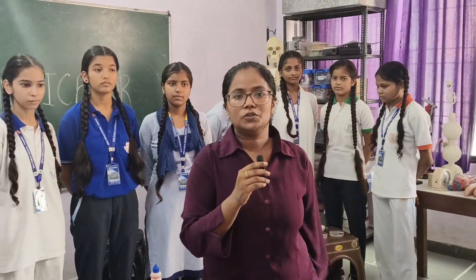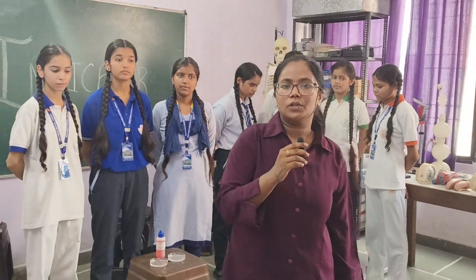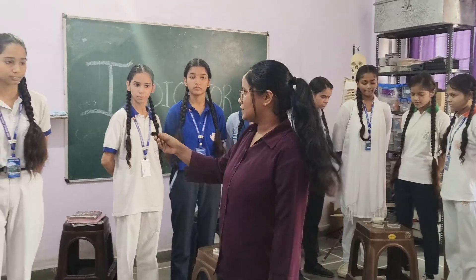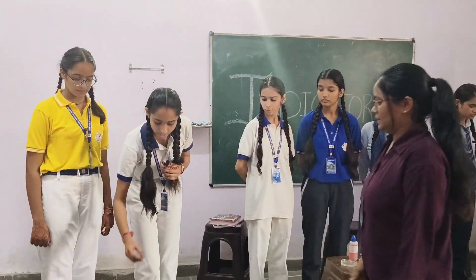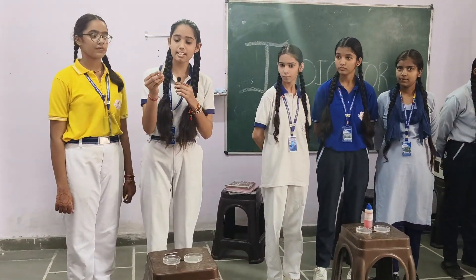Good morning. Today students of class 10 are going to show you different types of indicators. First of all, there is a natural indicator.